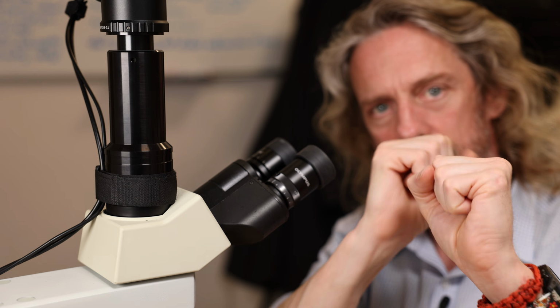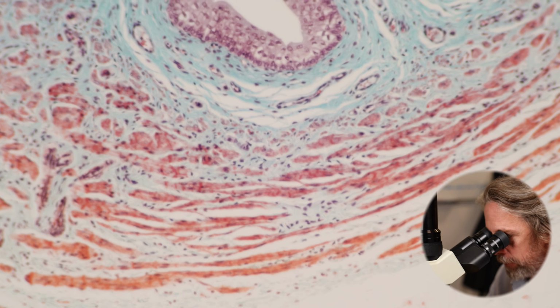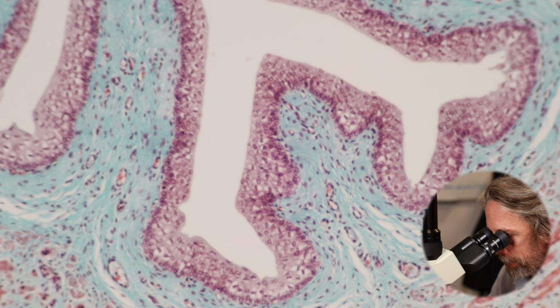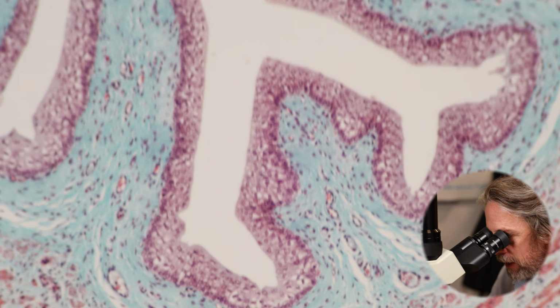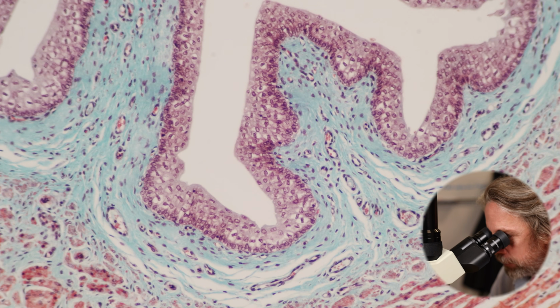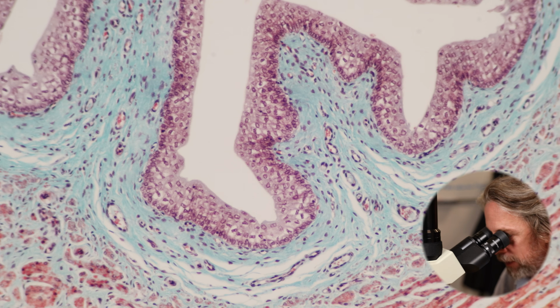You have circular muscles that squeeze the contents along, and longitudinal muscles shorten the tube to push everything along. And there are chemoreceptors in here that are sensitive to ischemia, reduced blood flow, and to inflammation. So when a kidney stone passes into the ureter and blocks the ureter, while the kidney stone itself is stretching everything, you get a backflow of urine behind this, which is stretching everything, it's causing inflammation. Everything's very unhappy, lots of pain sensors are firing, and this is incredibly painful.